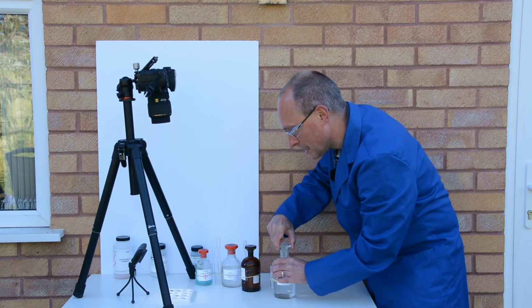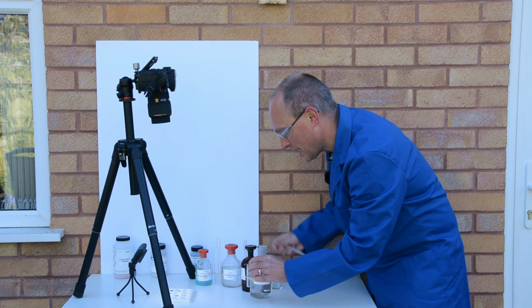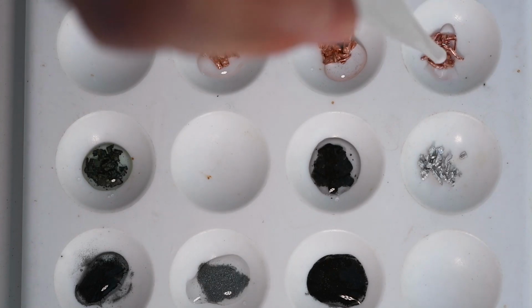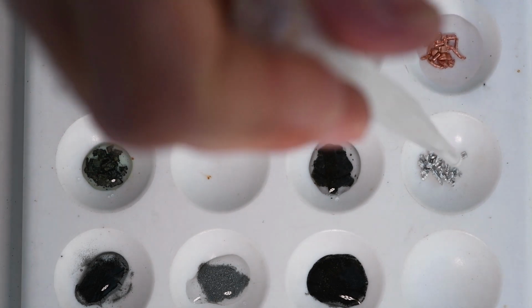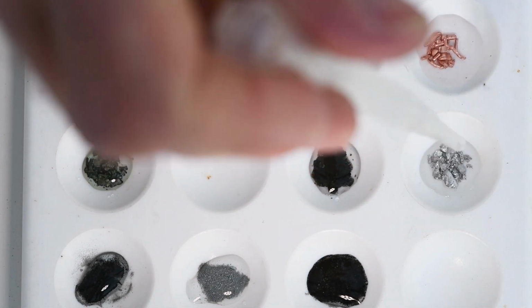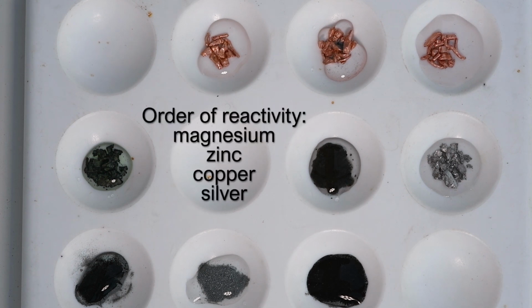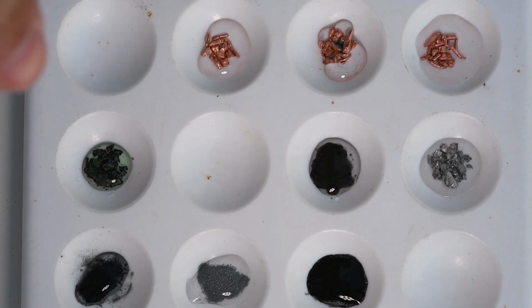And then finally I'm going to add some zinc nitrate to the copper and to the magnesium. So for these 4 metals we would expect the most reactive element to be magnesium, followed by zinc, followed by copper, and then silver being the least reactive of these 4 metals.